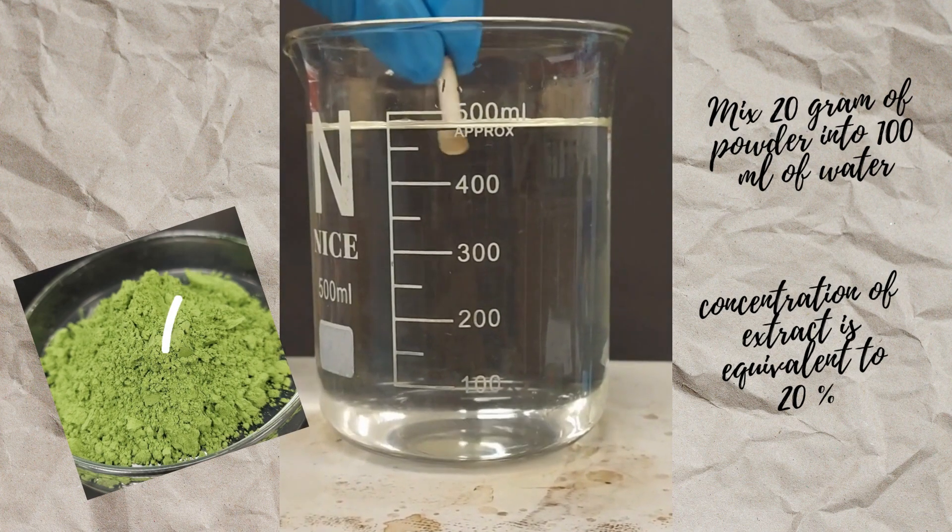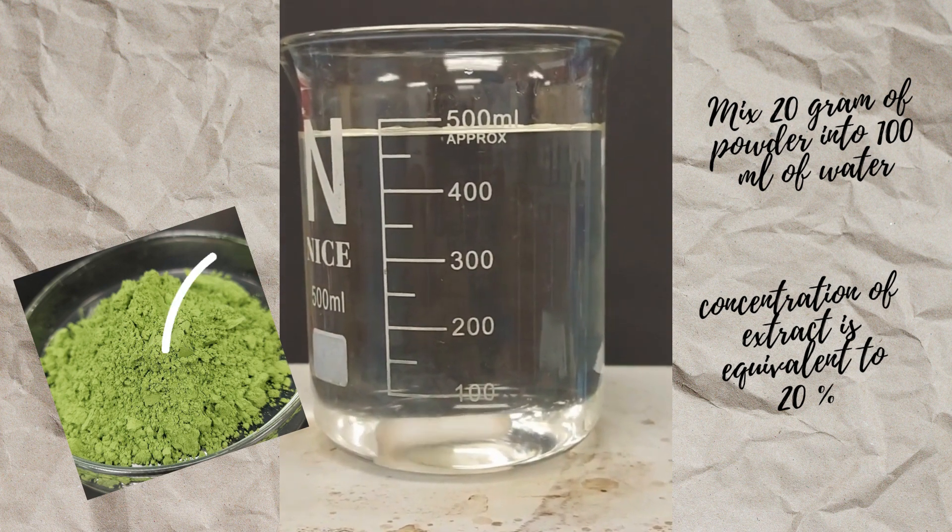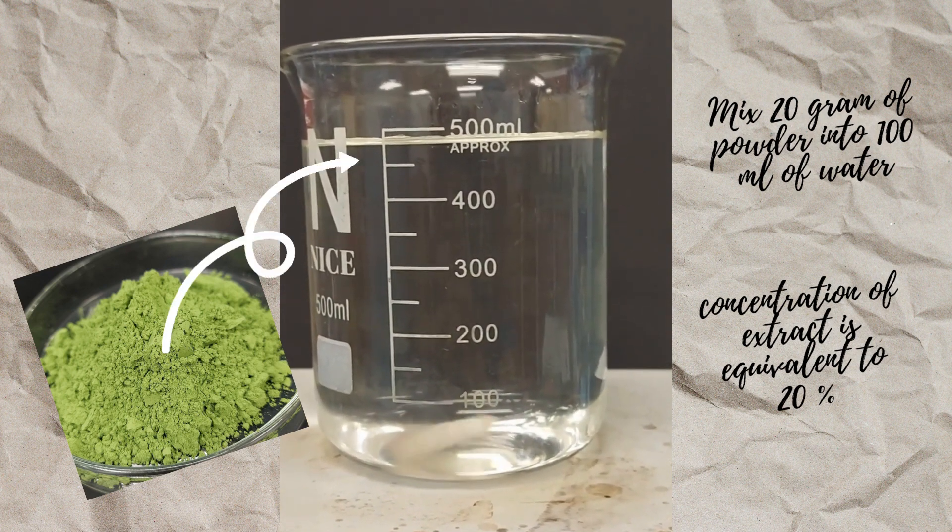Add 20 gram of leaf powder into 100 milliliter water. Later, stir the mixture overnight.